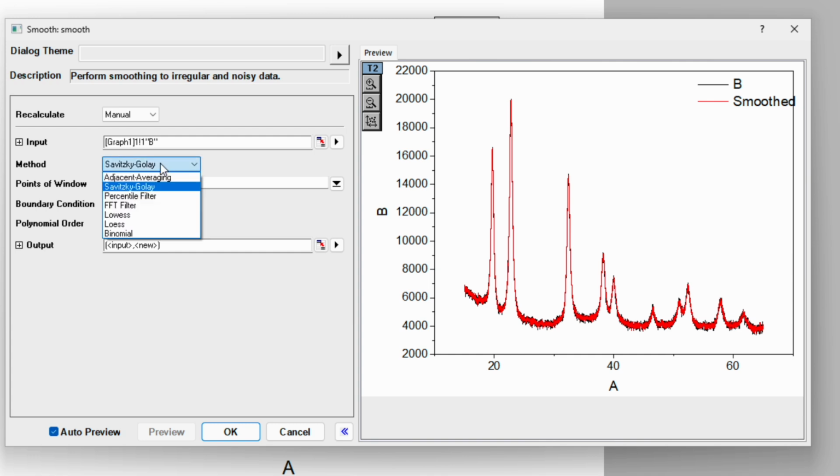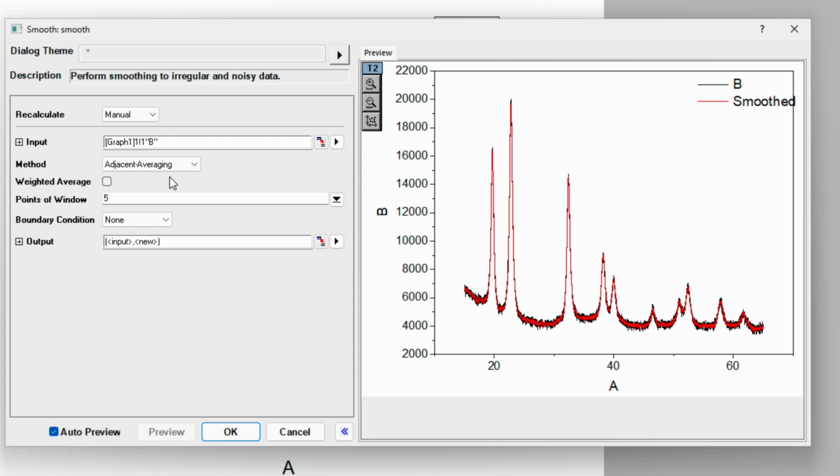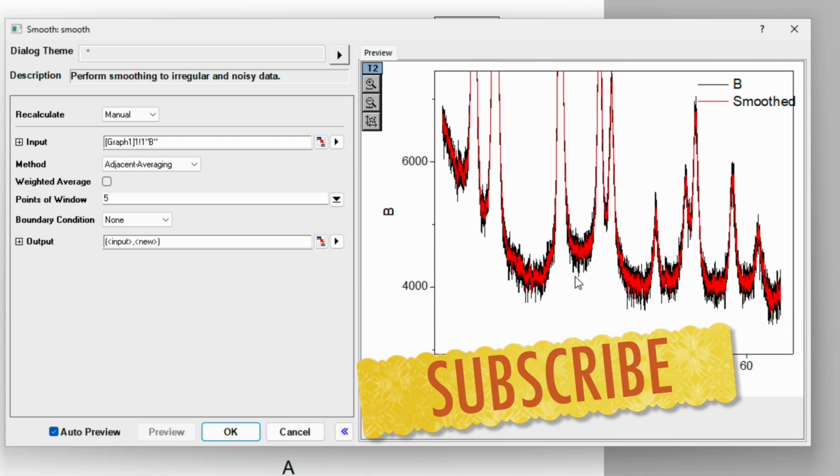And if you go to the method option, then there are a few methods which can be used to smooth the data. Here I'll be showing an example by using adjacent averaging. So click on this method and then you can choose the points of window. Depending on the points of window, the data smoothness will vary. To see a closer view, select the zoom option and select the area which is more noisy.